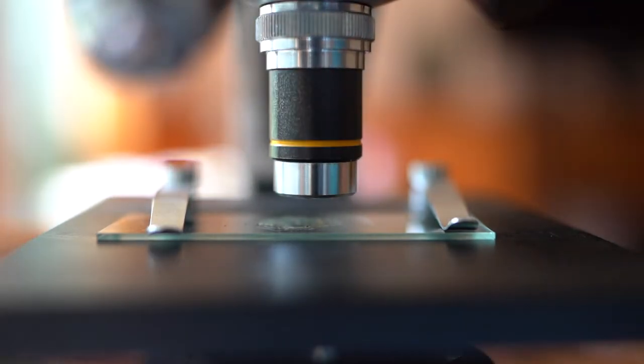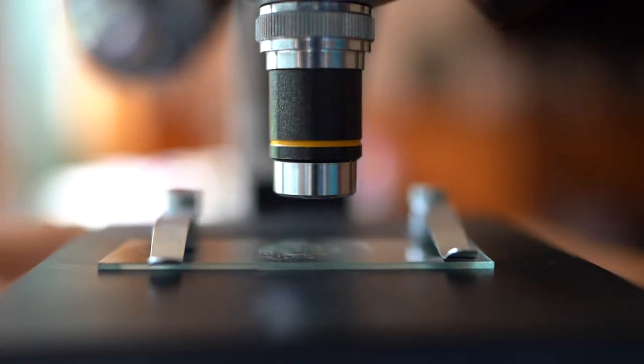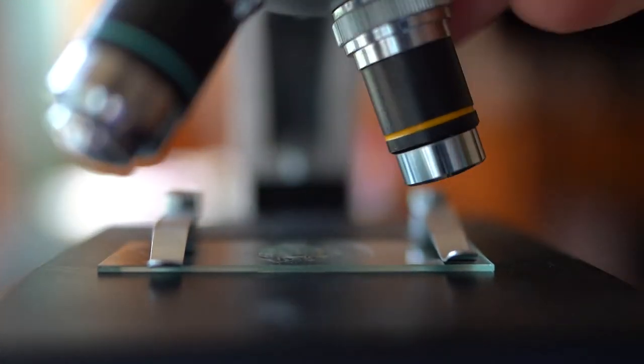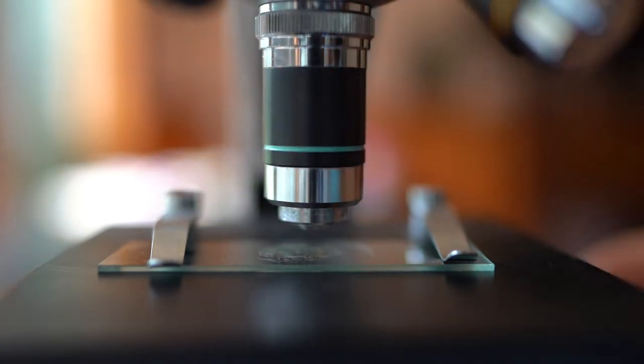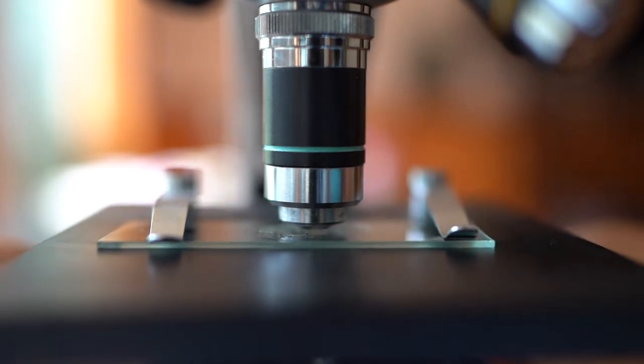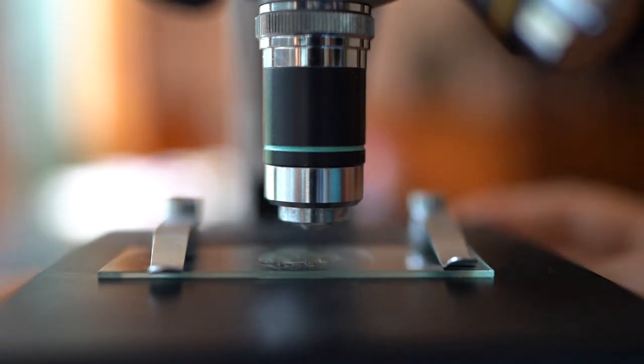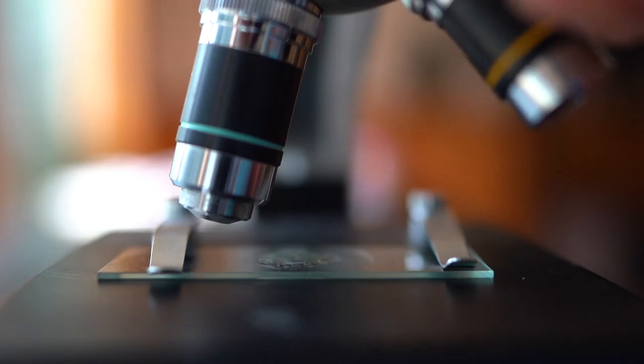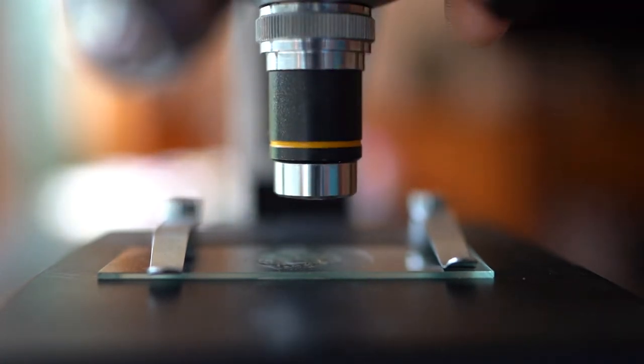I always want the lowest power that the microscope can handle because it allows me to find my specimen easier and it also won't dirty up a lens. As you can see here, the slide actually contacts the highest power we have here and that lens can get kind of dirty. So I'm going to go to our lowest power, which in this case is red or 4X.